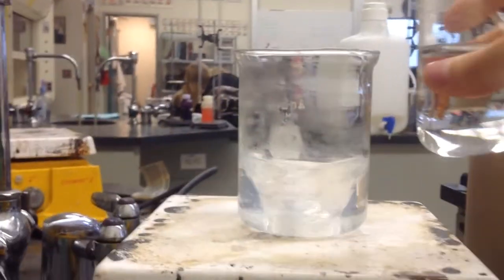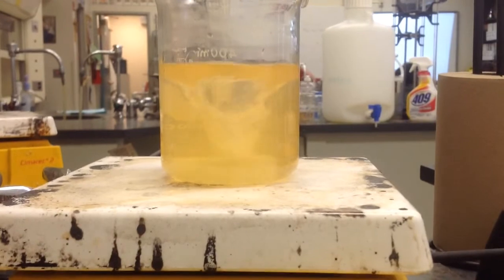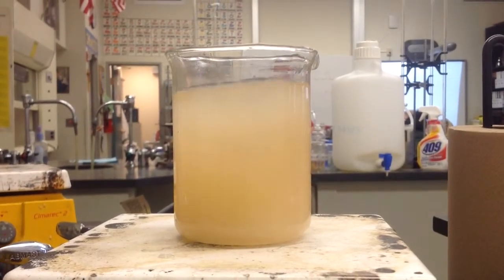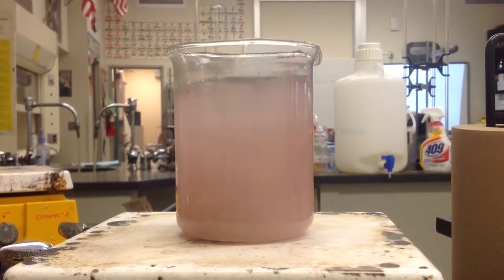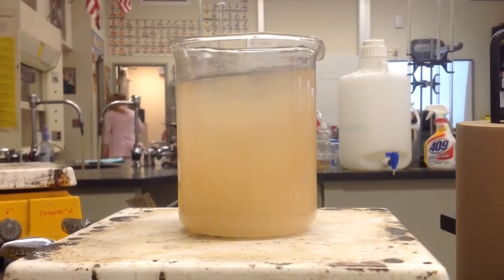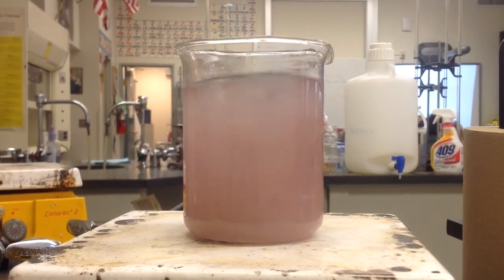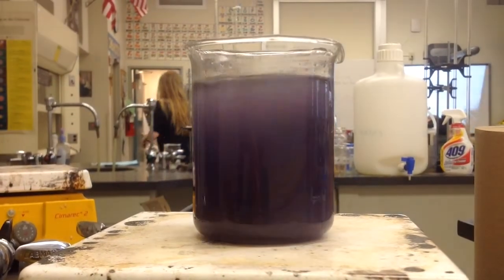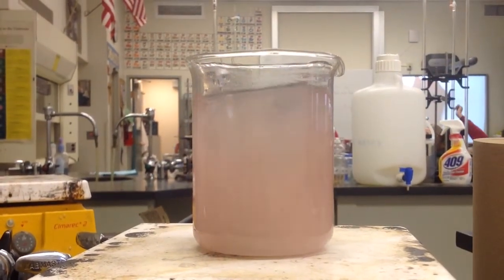To begin this demonstration, I've added 50 milliliters of solution B, which was the potassium iodate solution, and 50 milliliters of solution C, which was the manganese(II) sulfate, malonic acid, and starch solution. To this, we also added 100 milliliters of hydrogen peroxide, or solution A, which is what initially caused that first color change to amber. Eventually, as you can see, the reaction goes on and the amber instantaneously changes to the dark blue color, before the dark blue color slowly shifts to a colorless and then back to an amber solution.